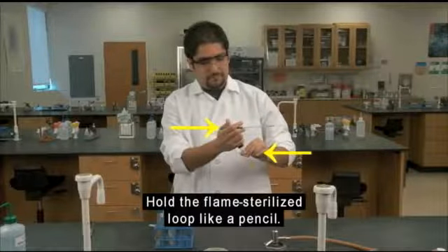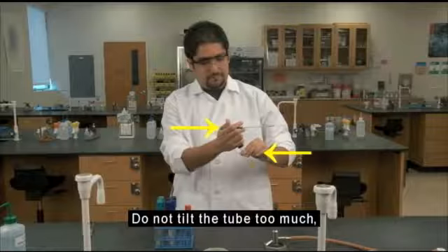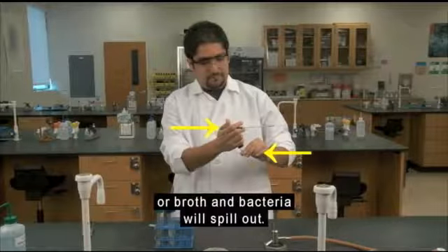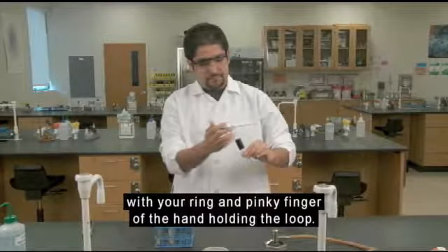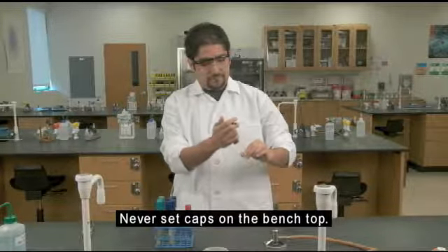Hold the flame-sterilized loop like a pencil. Hold the test tube at a slight angle with your other hand. Do not tilt the tube too much, or broth and bacteria will spill out. Remove and hold the cap with your ring and pinky finger of the hand holding the loop. Never set caps on the bench top.